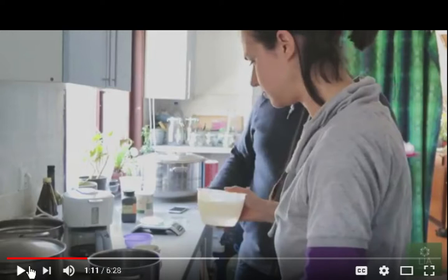Since I'm starting out with this, I'm going to be trying different control dishes for my environment and make sure that I know what grows in the dish besides mycelium. And if you notice, I believe that's the solution, so she's got it in her hand. Everything's pretty much out in the open.